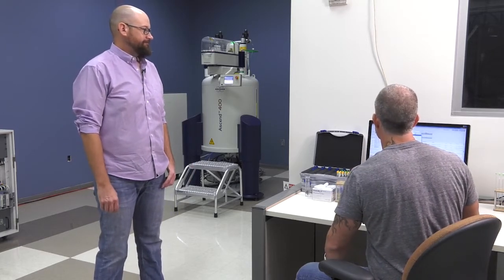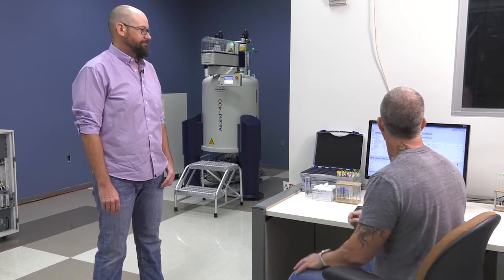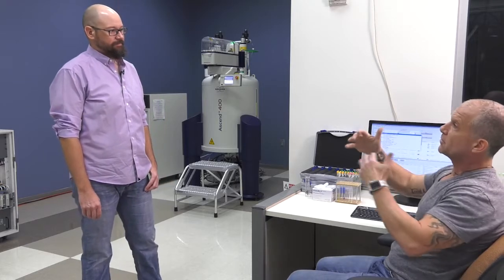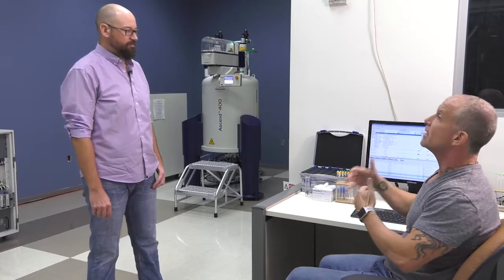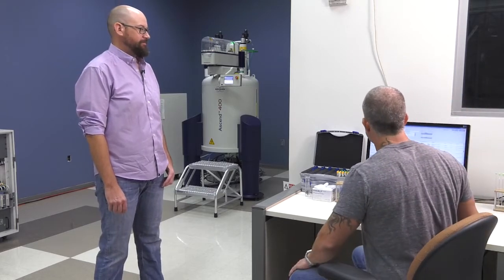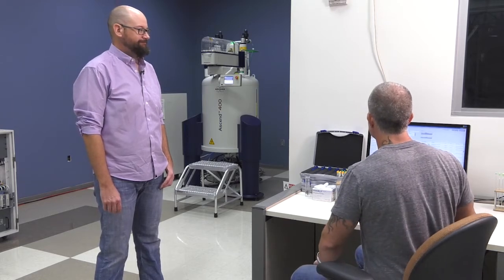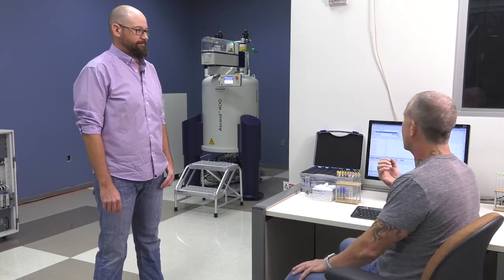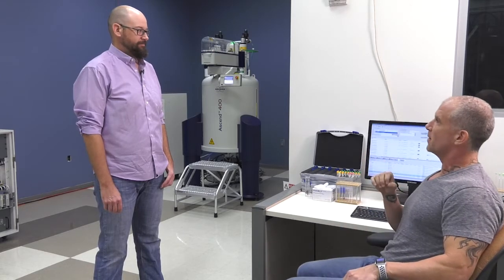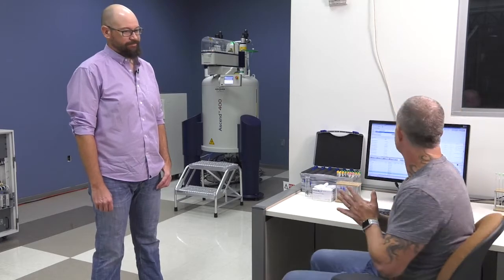And then it's another drop-down menu for the experiments. And the experiments are either single experiments or composite experiments. Correct. And these are run in queues during both the day and evening? Yes. And so in this case, we're running kind of a standard sample. So I've entered a name. It's in deuterated DMSO. And we're going to run what I would say is the most common NMR experiment, which is just a spinning 1D proton NMR. Correct.